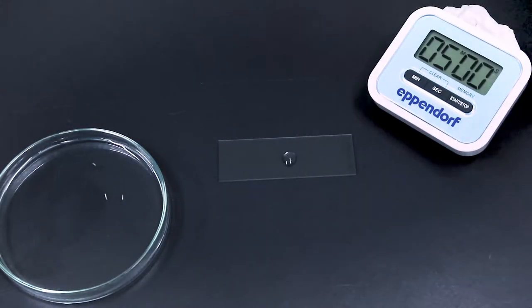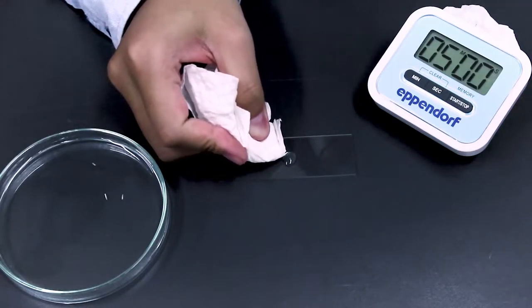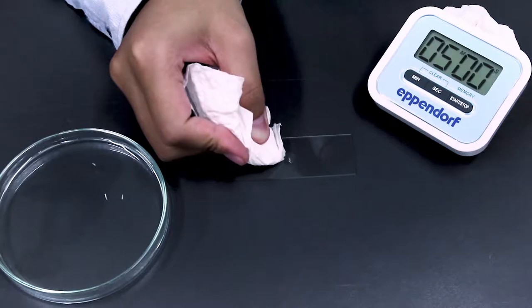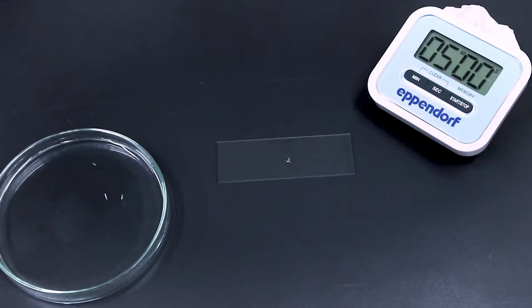We clean it with water twice. Now you just get off the water that we already used. Again leave it for 30 seconds. Now you remove all the water, so be careful at this stage. Don't get off your root tip, just get off the water.